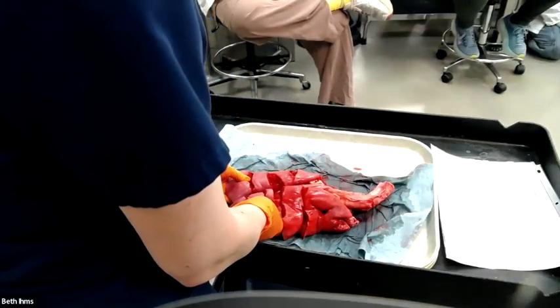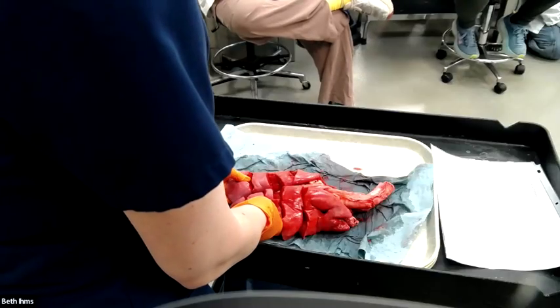The fibrin isn't just specific to lungs, we'll see that in other tissues as well. So all the processes we're talking about, none of them are really going to be specific to an organ. Some of them, like lipid and amyloid, might have a preference for certain organs, but all the processes we're talking about in this class can happen anywhere in the body. So that's what we're focusing on, foundational approaches that you can use in every organ, right? When you see fibrin being exuded, that tells you that there is acute inflammation happening in the tissue.